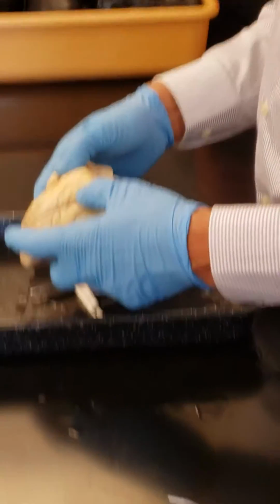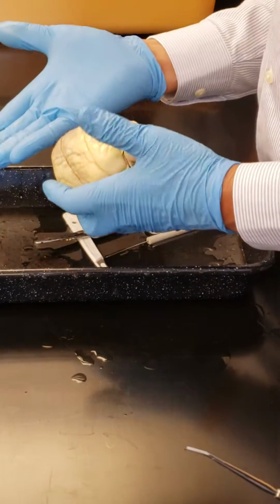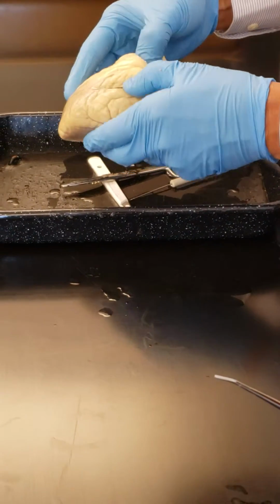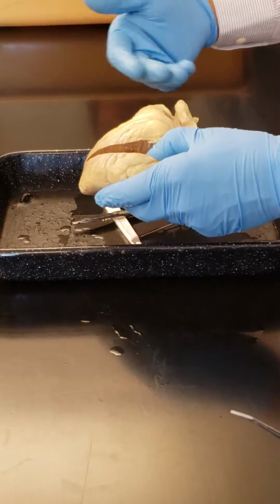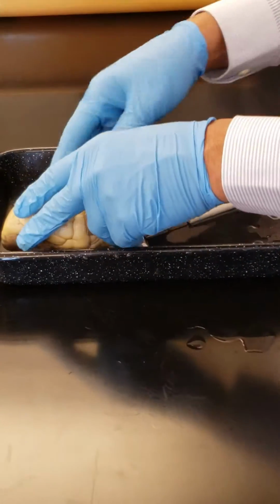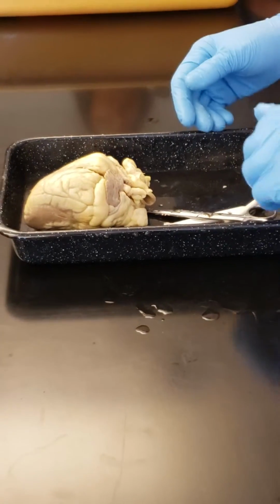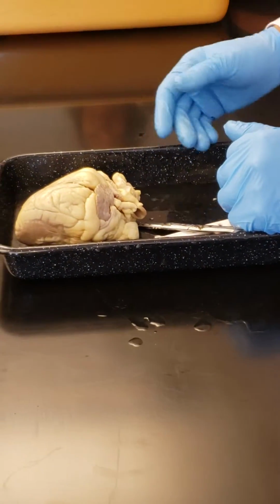Okay, so I'll just leave it here. I have seen other professors, they just cut it in half and then show it. So I think this way you can have a much better appreciation of the blood flow, which flows from here to there. Okay, so I'll just leave it here for now, and you can dissect. You can work in groups, maybe 2 people or 3 people or 4 people in a group, and dissect it, and then we'll start the EKG.